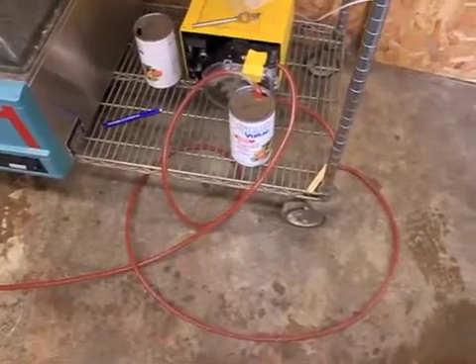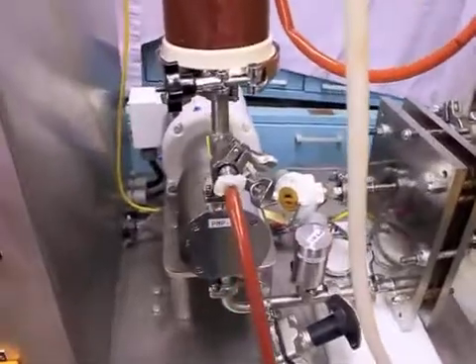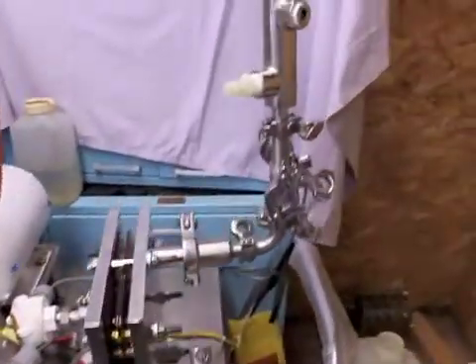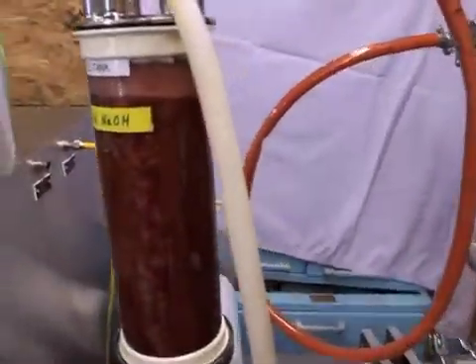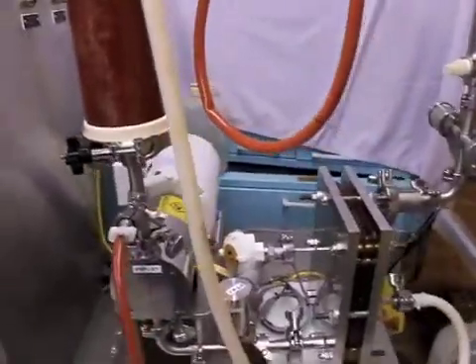We're taking vegetable juice or tomato juice, pumping it into the filtration skid, goes into the pump, circulates through the filter, out of the filter, and back into the recirculation tank. The idea of this process step is to concentrate the solids.